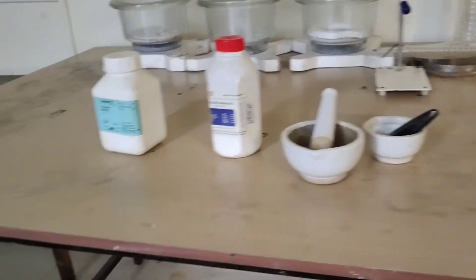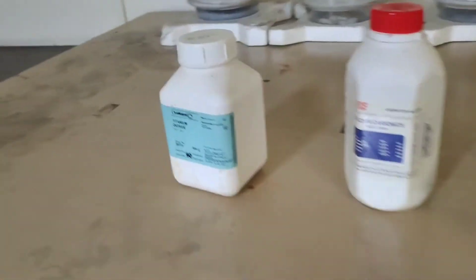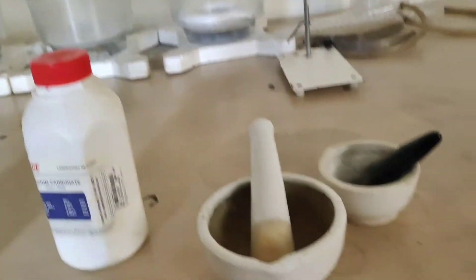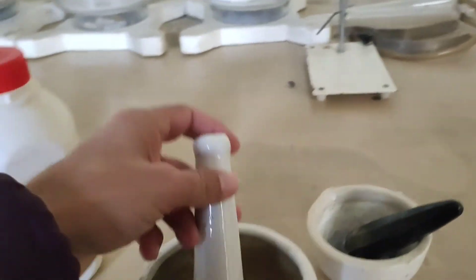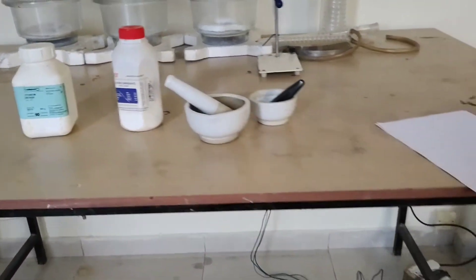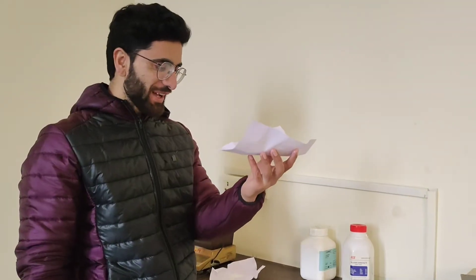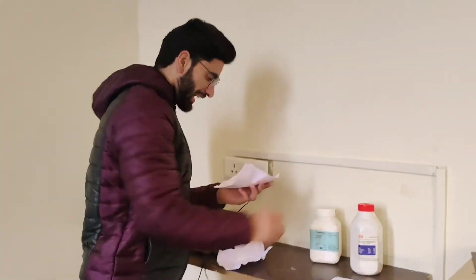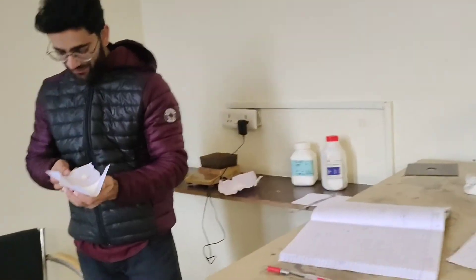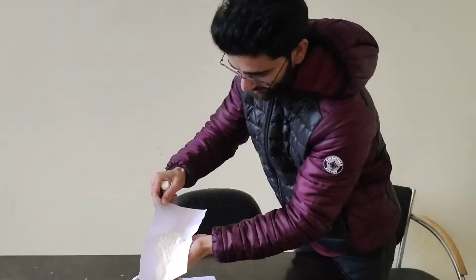This is titanium dioxide and this is calcium carbonate. This is a mortar. We are using the solid-state method to do the experimental part. Now we have taken titanium dioxide — about 46 grams — and we can put it into the mortar and pestle.